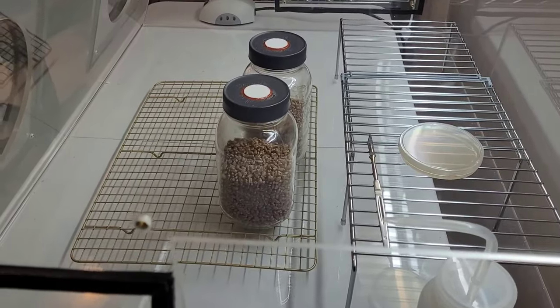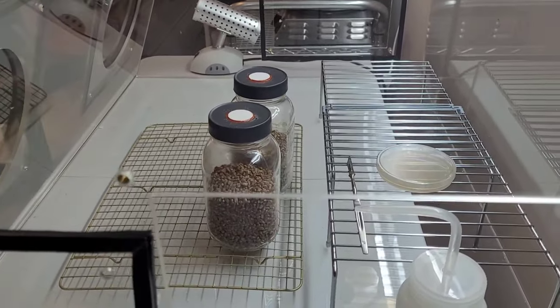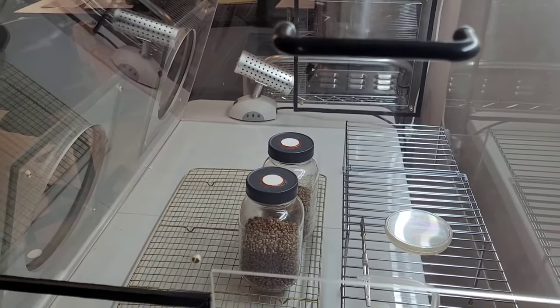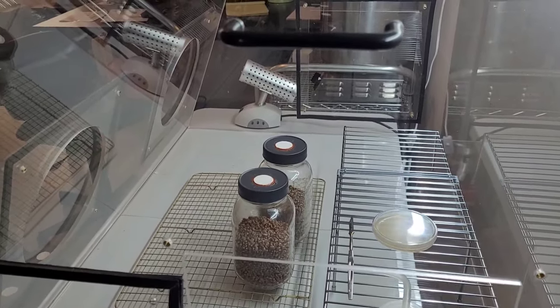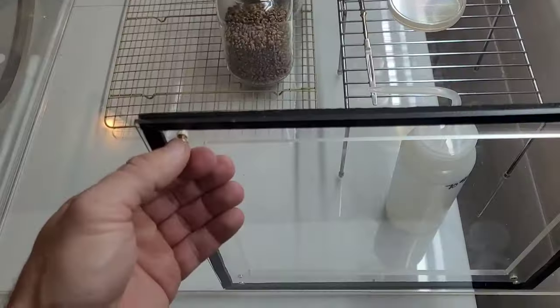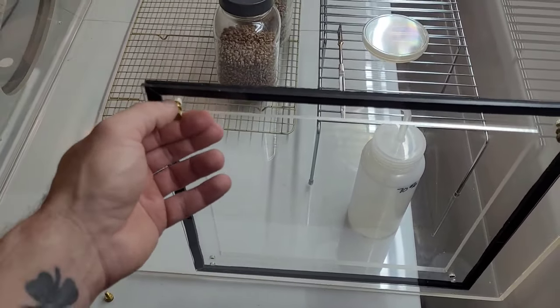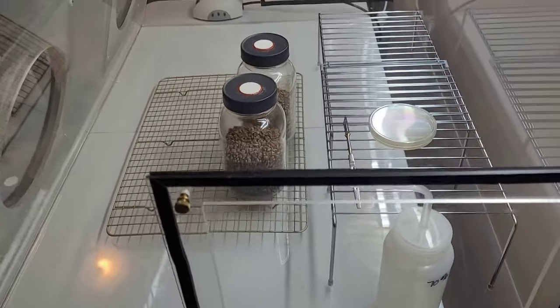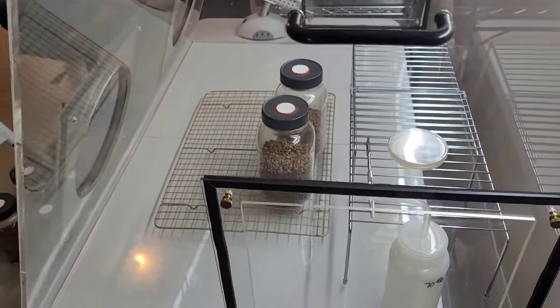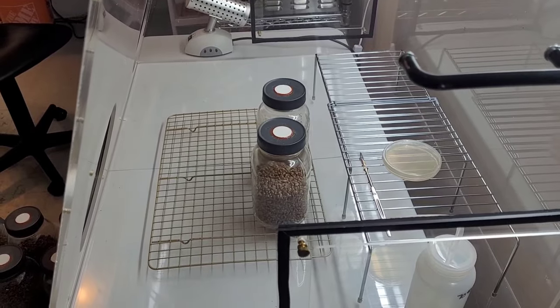Now this is when somebody will argue, well why don't you just sterilize or sanitize the inside of your still air box? Well, because that's impossible. There's no way you can sterilize or sanitize the atmosphere that is exterior to the still air box which becomes encapsulated within its interior. This is why we rely upon physics to maintain sterile work conditions rather than sanitizing agents or the impossibility of actually sterilizing the entire interior of a still air box.